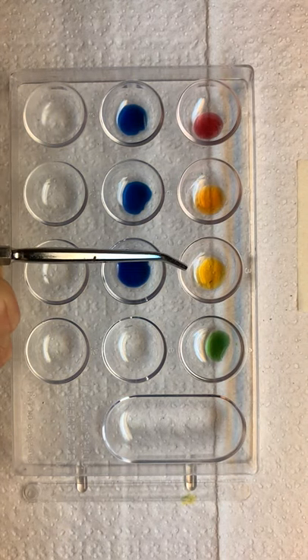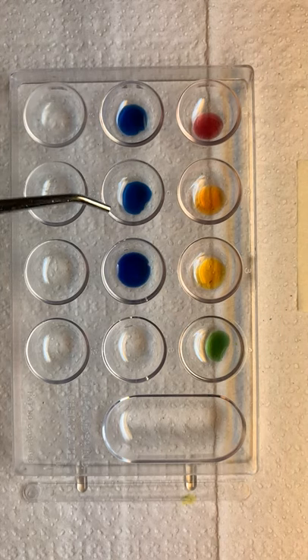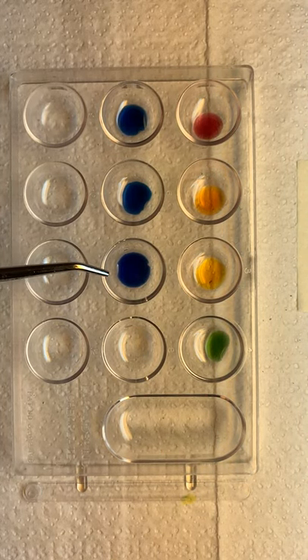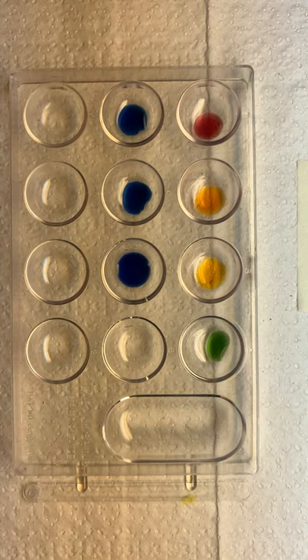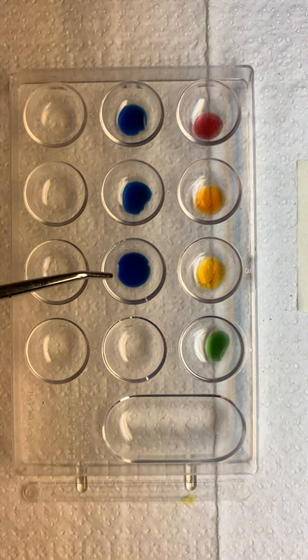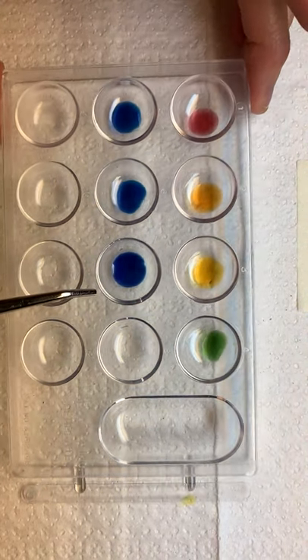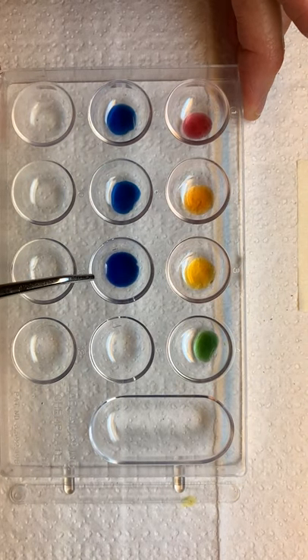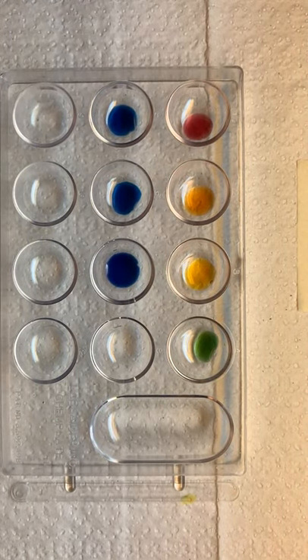R-O-Y-G-B-I-V with the last one being violet and very dark purple. Now here it may not look that way to you because it's on a video, but it does have tones of deep purple in it. All right, so that's our key.